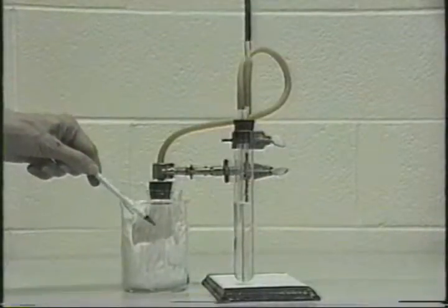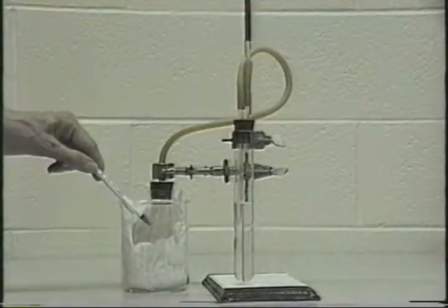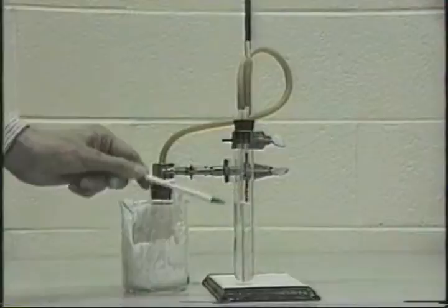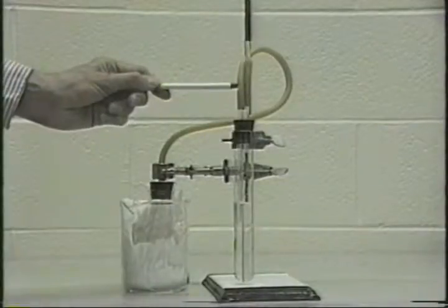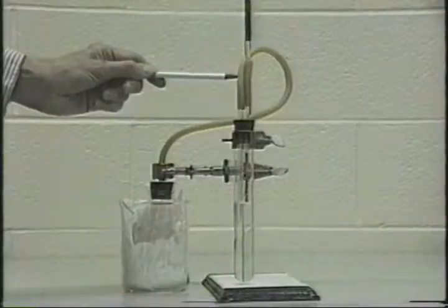We will put in this flask dry ice and stopper it tightly. The dry ice will slowly sublime, giving off CO2 gas. The CO2 gas will pass down and bubble in through the solution and then out through the Bunsen valve here. Now, the Bunsen valve has a small slit in it to let out the CO2.